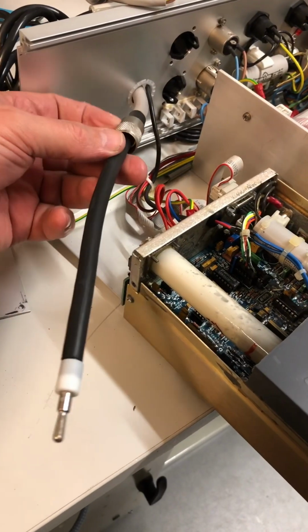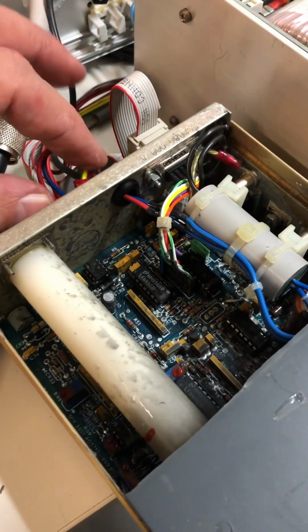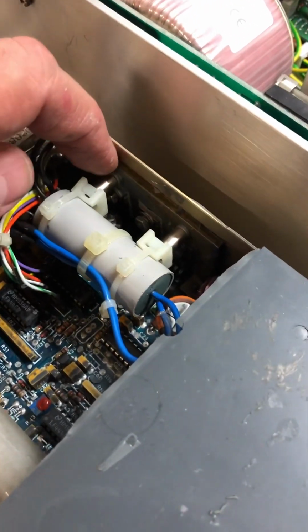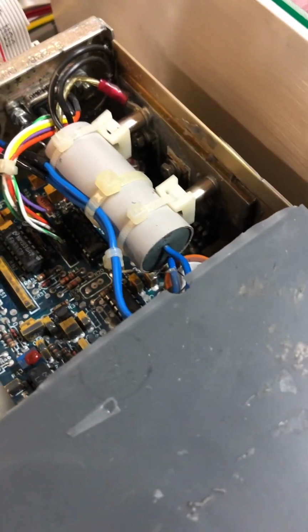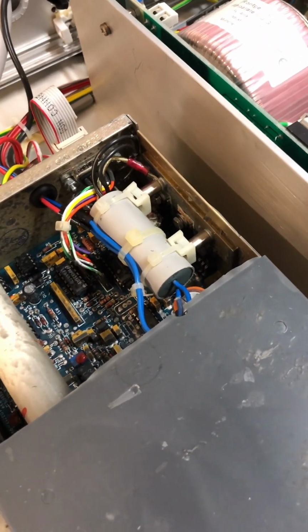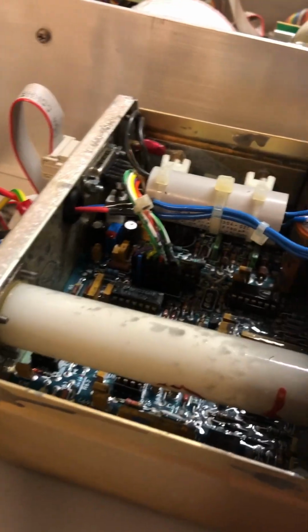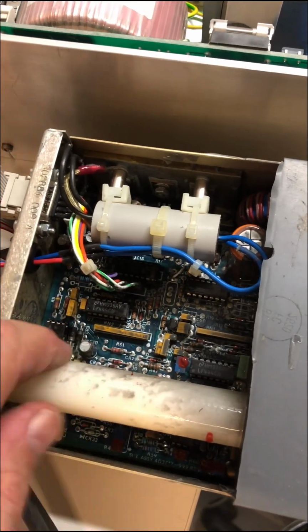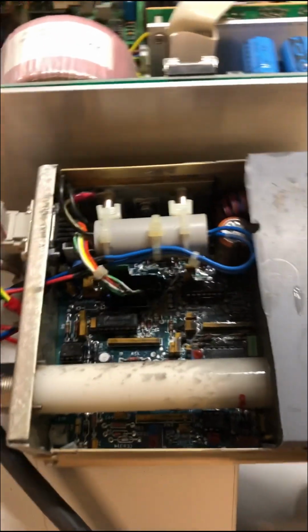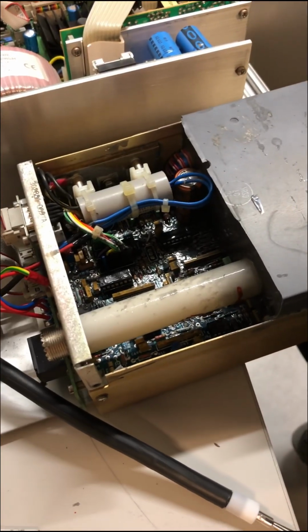Voltage cable disconnected. Inside we see control, a sub-D connector and power line, which is filtered, and 3 transistors. Probably 2 are in the oscillator and 1 is for regulation of the amplitude, voltage regulation. This is not dirt, it is silicone, which has come inside. But I will not try to get high voltage presently because I don't need it.